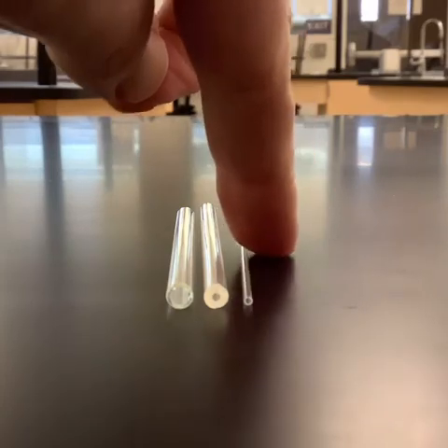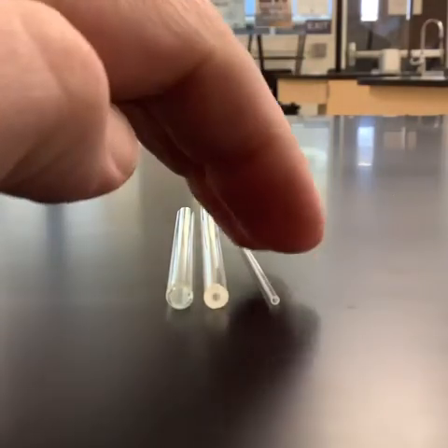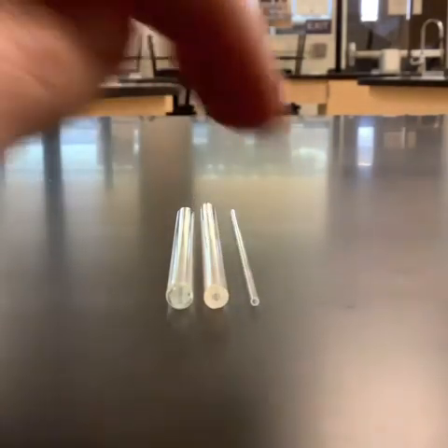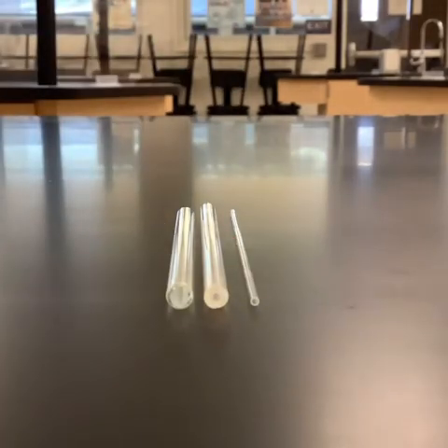So we can see that it's getting smaller and smaller and smaller in terms of the inside diameter. Now this last one is basically that the walls of that are about the thickness of maybe a piece of paper or something like that. So for this one, what we want to do is take these capillary tubes and put them in water, and try and see which one we're able to observe the most capillary action in. So let me get a little beaker of water here.